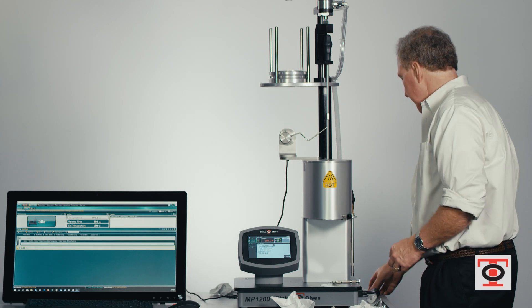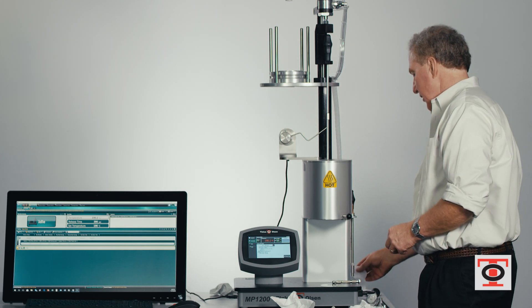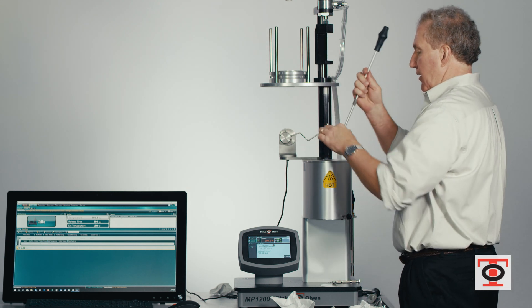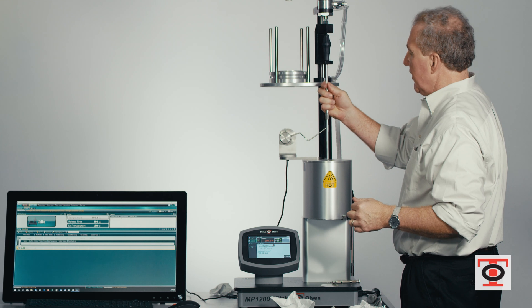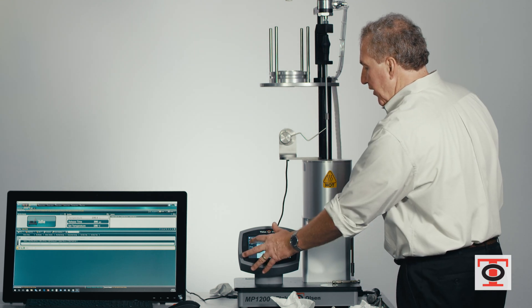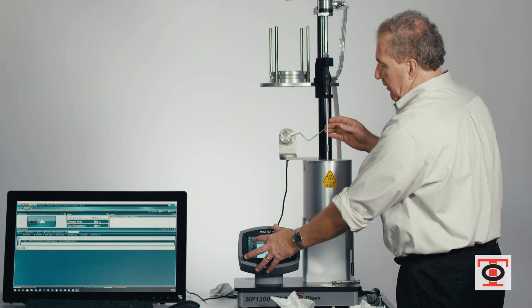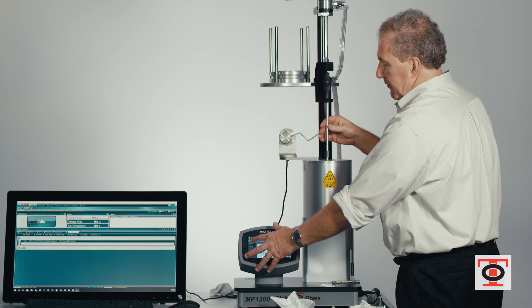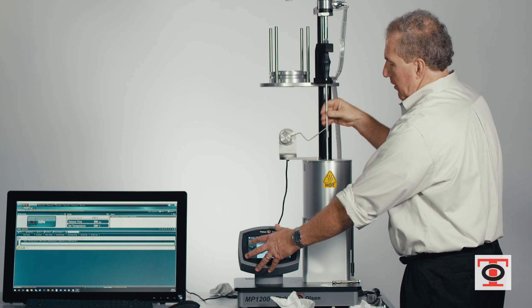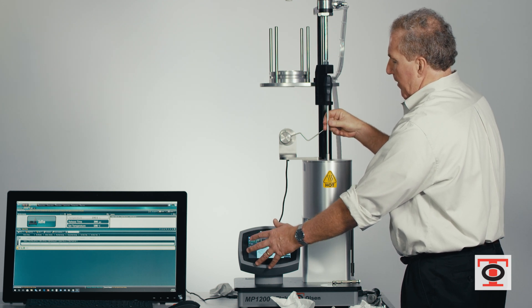After our die is clean, we can go ahead and use the clean assist to clean the bore. I put a cotton cleaning patch in position and then simply fire the cleaning cylinder and twist the rod.